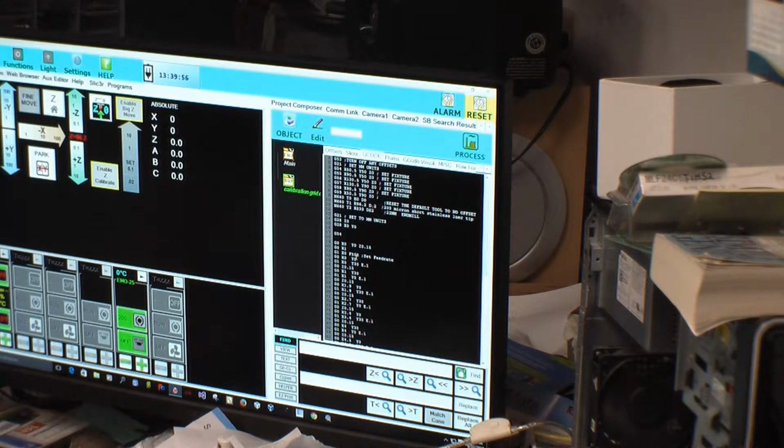Alright, so right now I have a G0, X0, Y0 and a Z of 0.15. That's got to be negative because it's going to be above the bed right now. So I'm actually going to give myself another one here. Let's see if I have a Z going down. Yeah, there's your Z right there. See that Z? That Z is 0.15. That should be negative. They should all be negative.